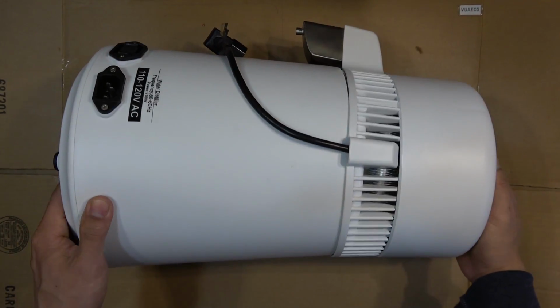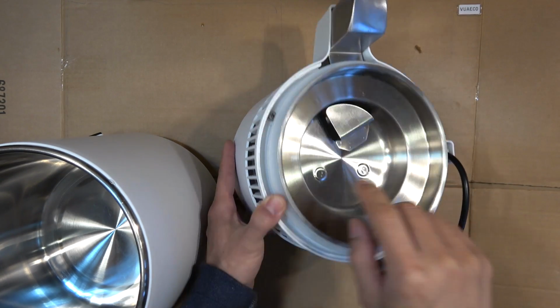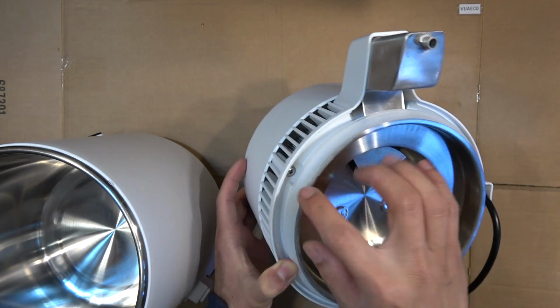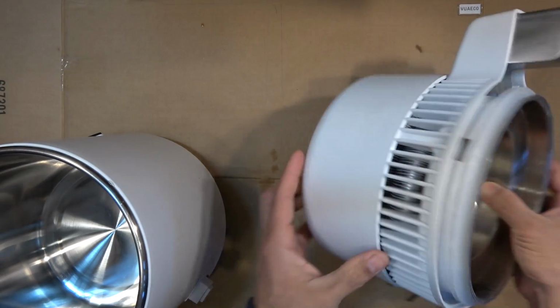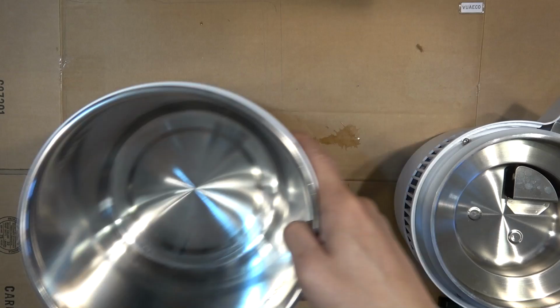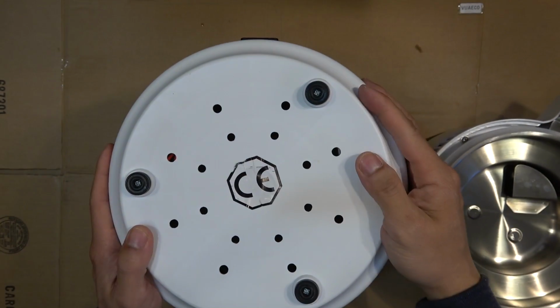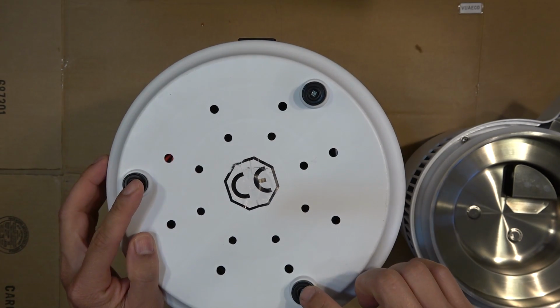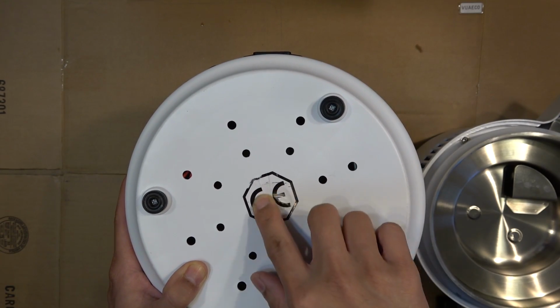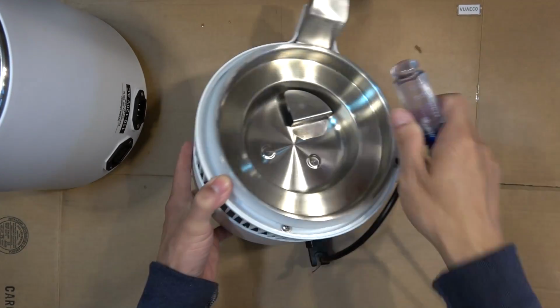So let's get started. Let's take a look at the top cover. It's got three screws. So I guess I just have to remove these three screws to get the top plastic cover off. And the pot itself. All the screws on the bottom. So we got three screws here. This sticker has something underneath. So I think there are more screws underneath this sticker. Let's remove the top cover first.